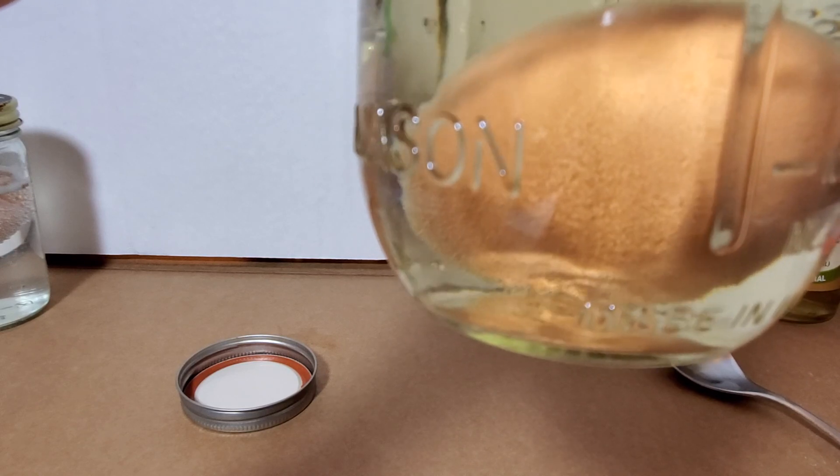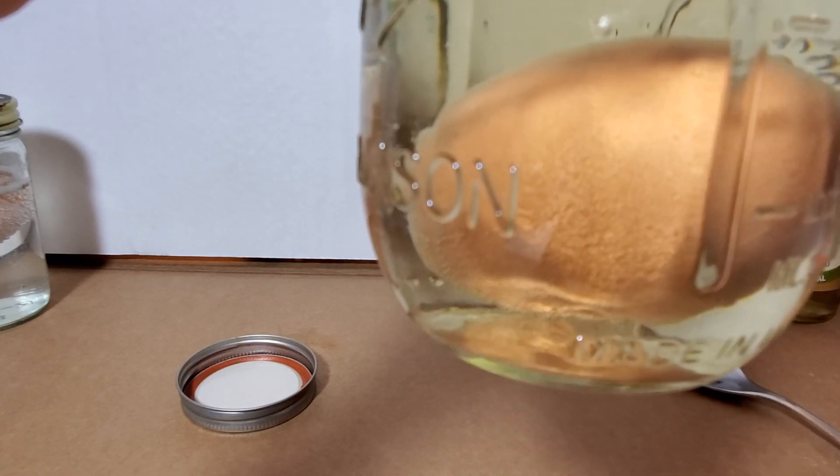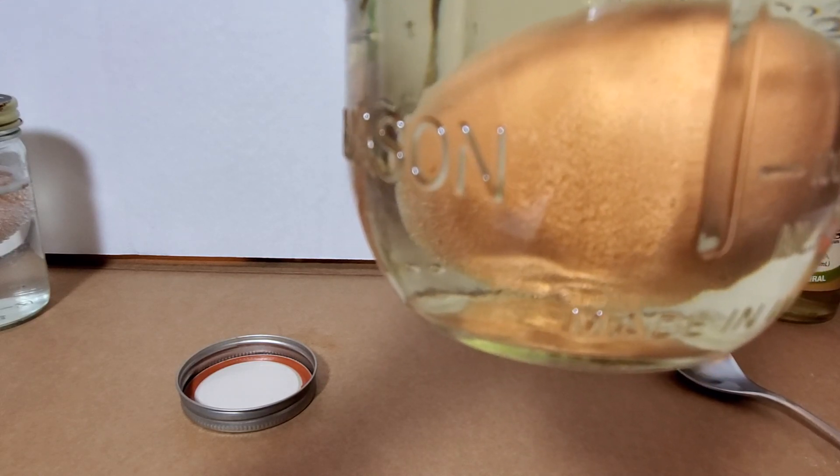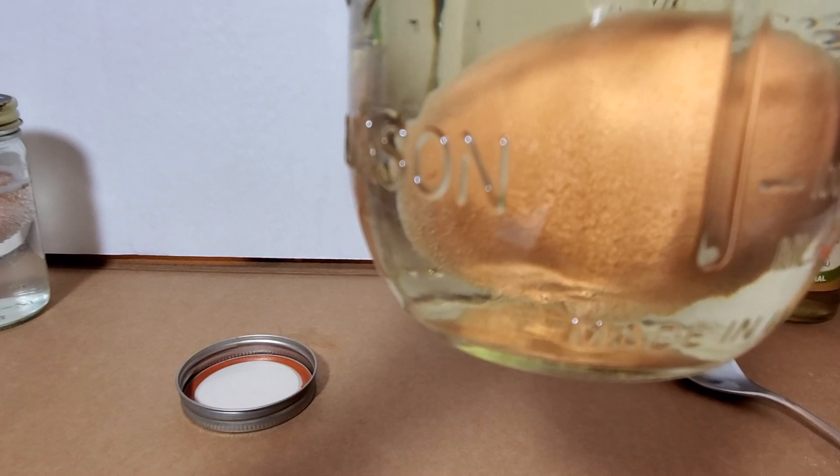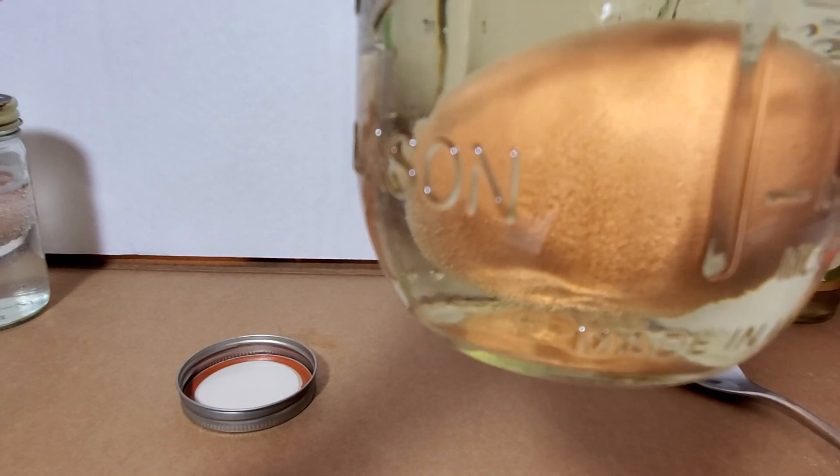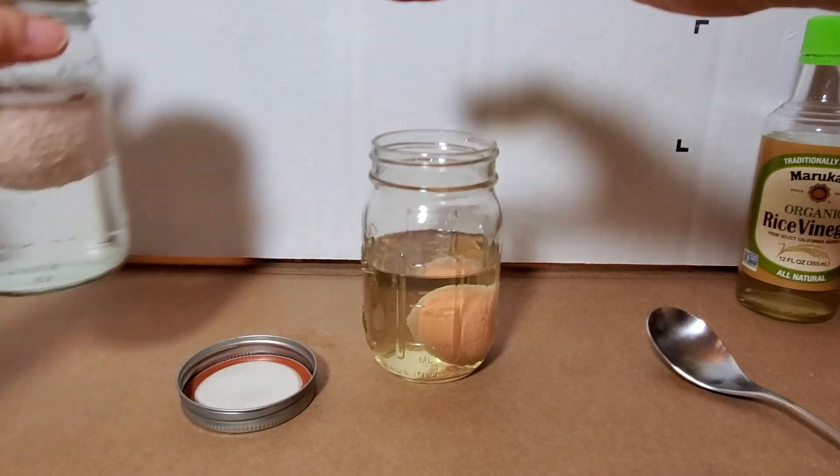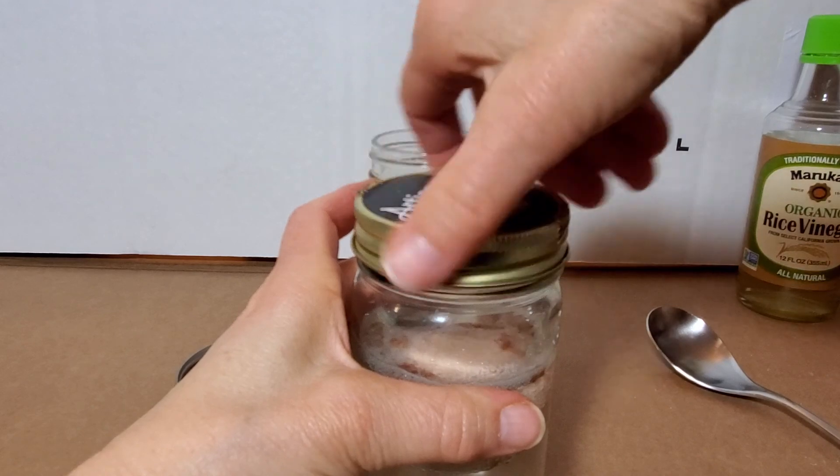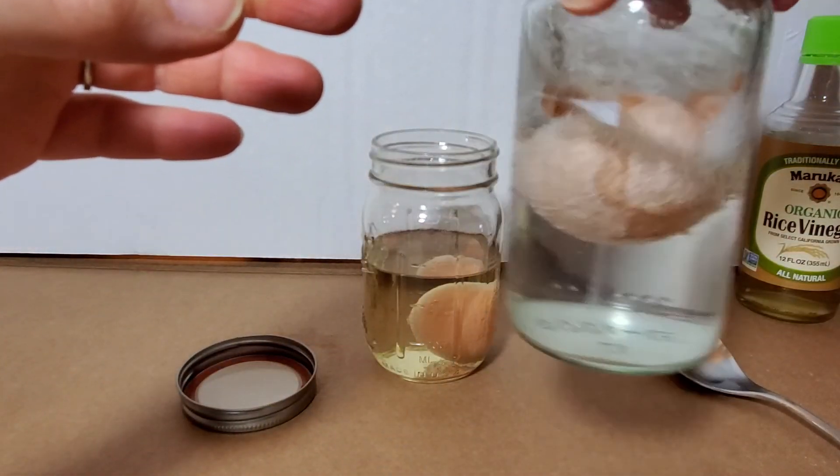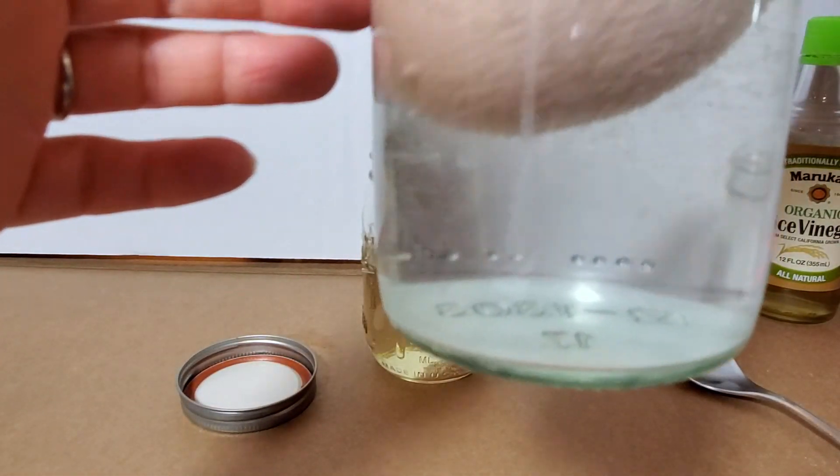Obviously you don't want to soak it too long. So we're going to soak this for at least a day overnight. We're not going to do this lab for two days. Two days soak makes it even easier. I put this egg in, I'm going to cap it so I don't spill it, about eight or ten hours ago. I did this this morning.